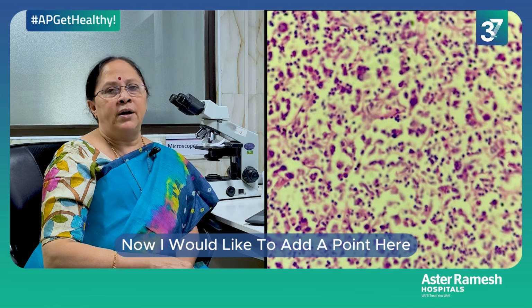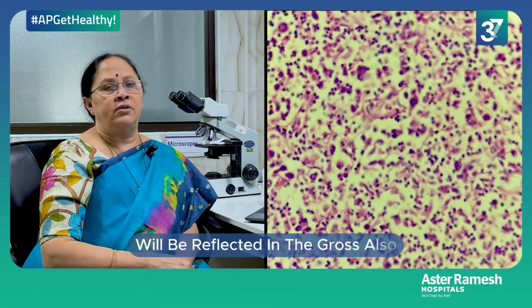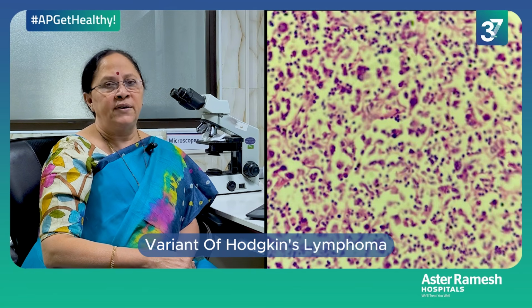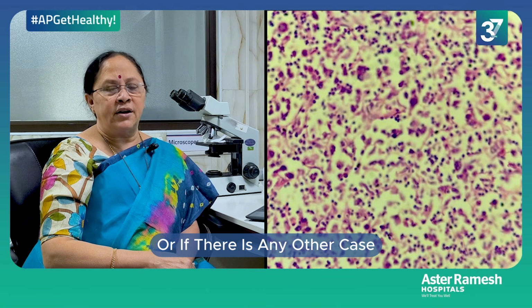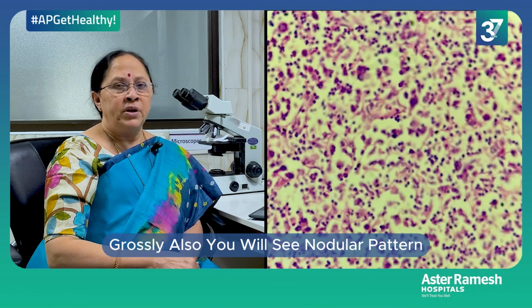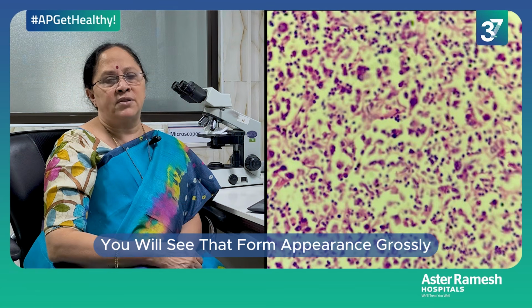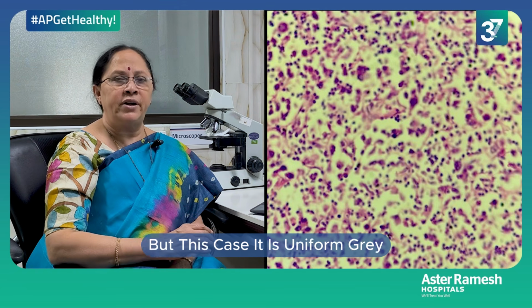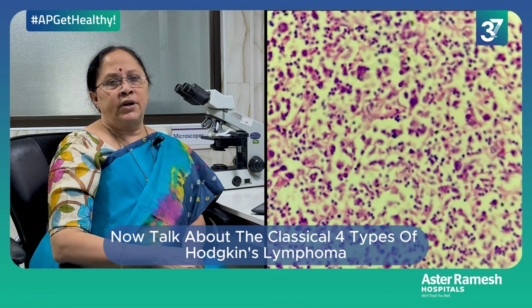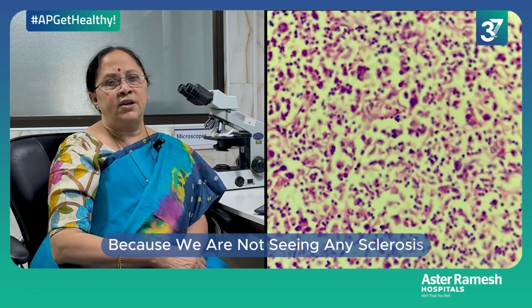Now, I would like to add a point here: whatever is the microscopy will be reflected in the gross also. If it is a nodular sclerosis variant of Hodgkin's lymphoma, or if there is any other case where there is nodularity, grossly also you will see nodular pattern, and especially in nodular sclerosis you will see a firm appearance grossly, but in this case it is uniform gray white and it is soft. So, now talk about the classical four types of Hodgkin's lymphoma. It is not nodular sclerosis because we are not seeing any sclerosis.